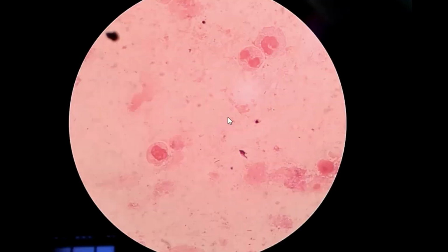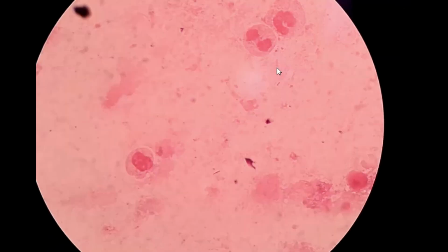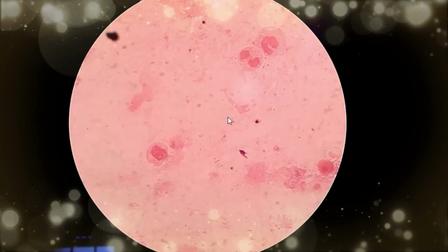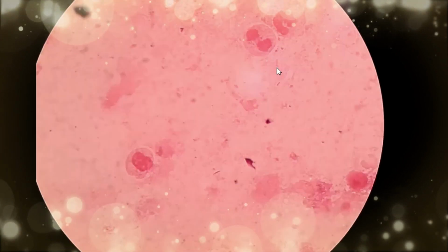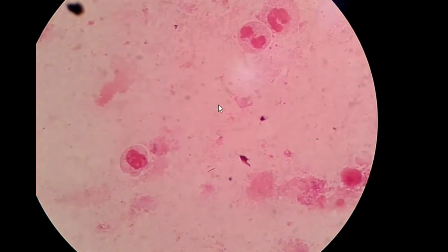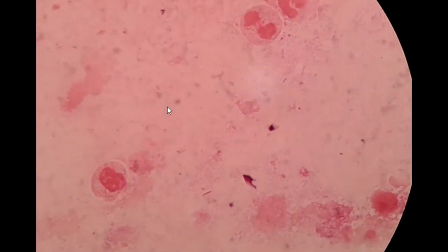Continue to examine the slide under oil immersion magnification for bacteria, yeast and polymorphonuclear white blood cells. It is also called pus cell, and proceed with culturing the specimen.